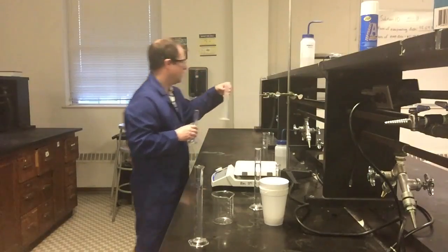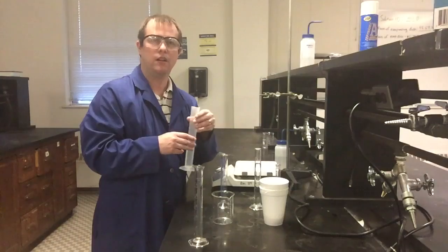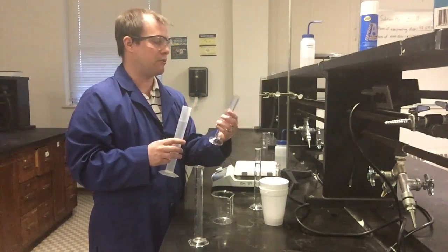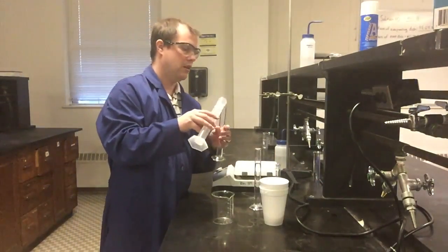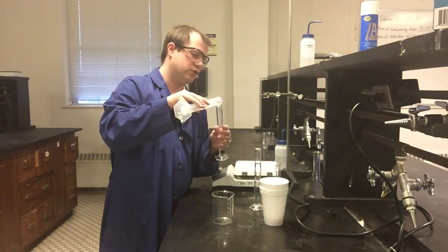And I actually have a pre-made sodium hydroxide solution back here. This is what we normally give in lab. It has a concentration of 1.05 molar already. And what I'm going to do is, again, get 50 milliliters of this one as well. So I'm going to measure out, again not in that graduated cylinder, this one. And I want 50 milliliters now of my sodium hydroxide solution.